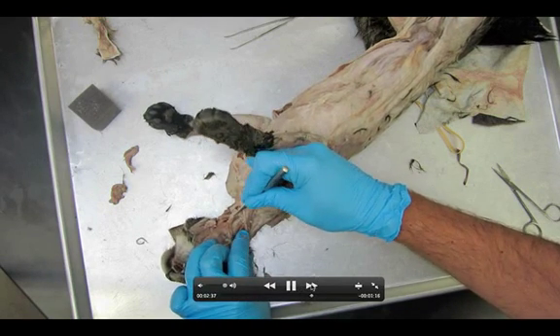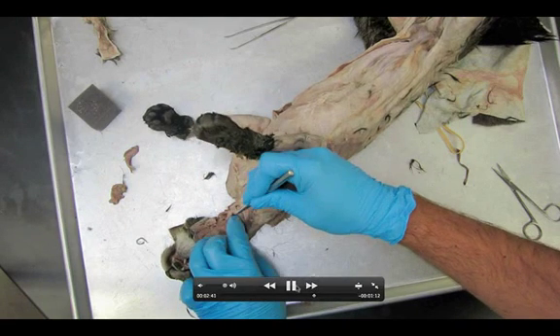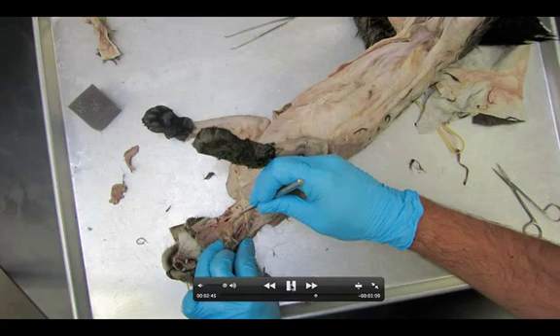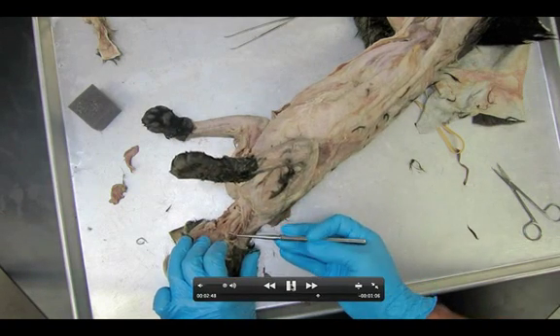You'll also be able to find the carotid artery — they've actually put a hole in it when they pump the cat. I'm poking it right there. The trachea would be right here. The trachea is a tube, the windpipe, and you're actually going to see these rings — they're blue rings of hyaline cartilage that are actually holding it open. Pretty cool to find the trachea right there on the cat. And in front of the trachea is the sternohyoid, and right here on my probe is underneath the carotid artery.